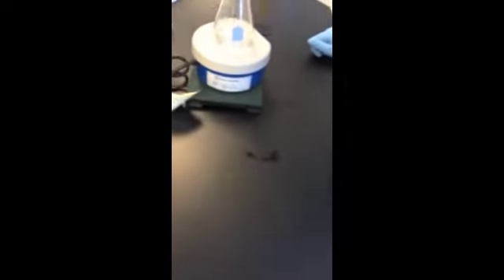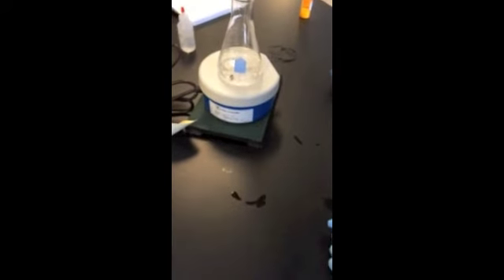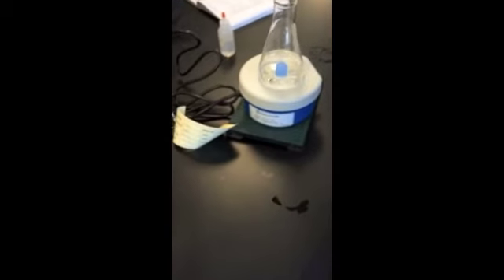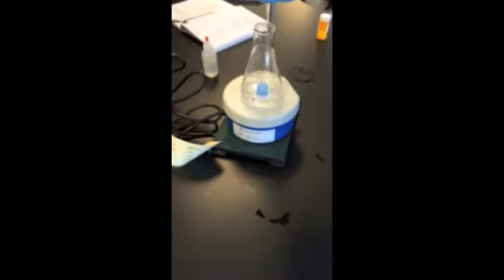The titration should then occur. Then the final volume will finally be recorded of NaOH in the burette. This needs to be repeated 2 more times, and then the flask can be rinsed with a small amount of acetone to dry it.